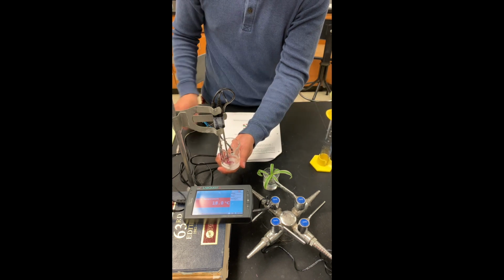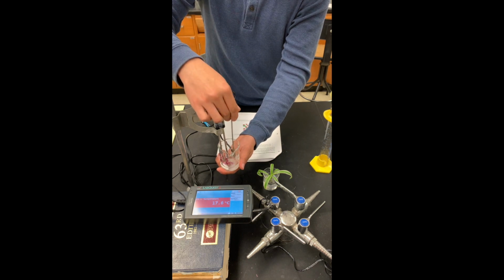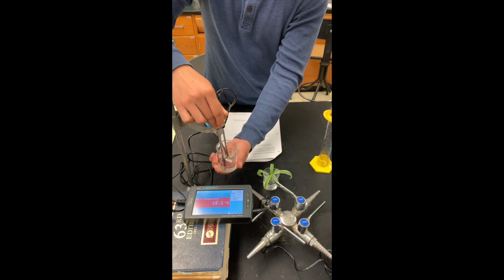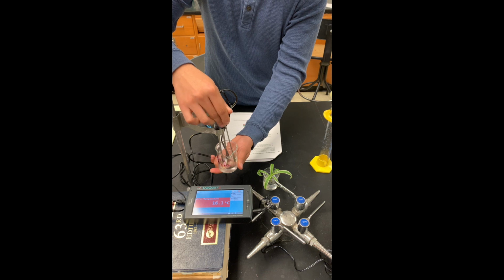And you can see the temperature drops slightly as a result of the temperature of the water. And observe the temperature as I mix the beaker full of the ammonium nitrate. And to describe, right now my hand feels colder than the rest of the ambient temperature.